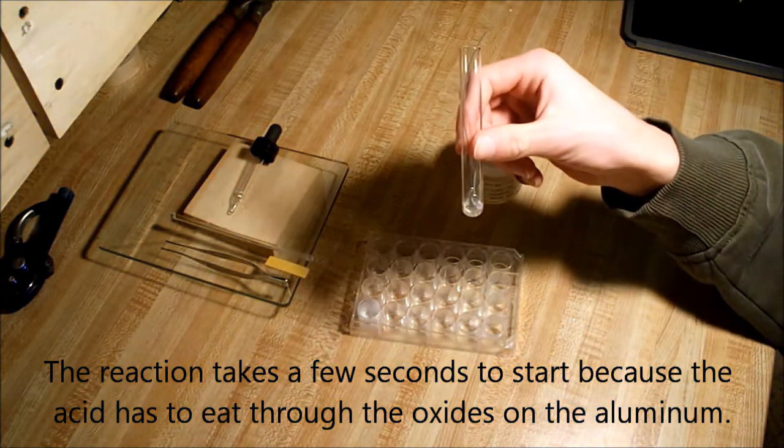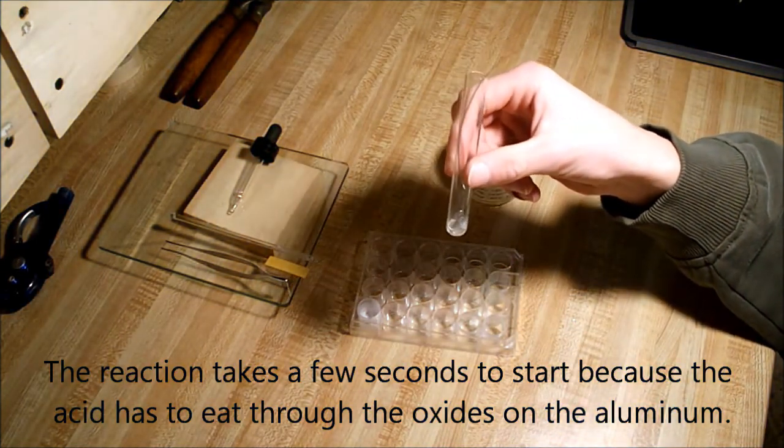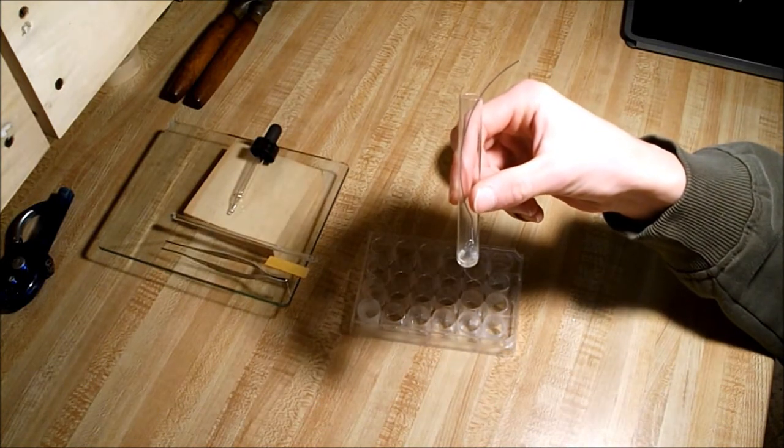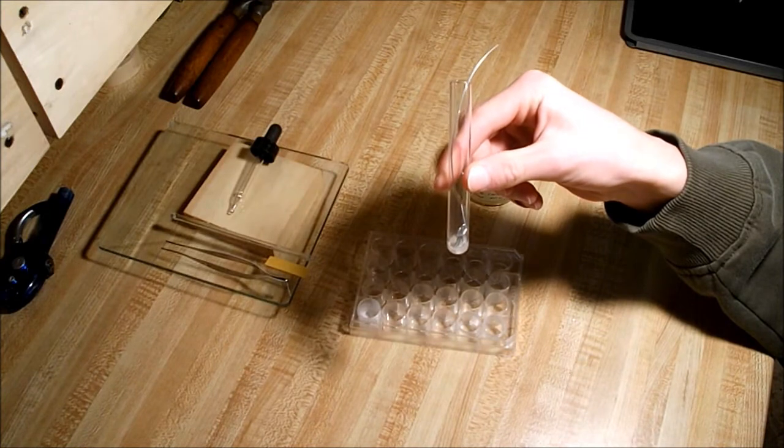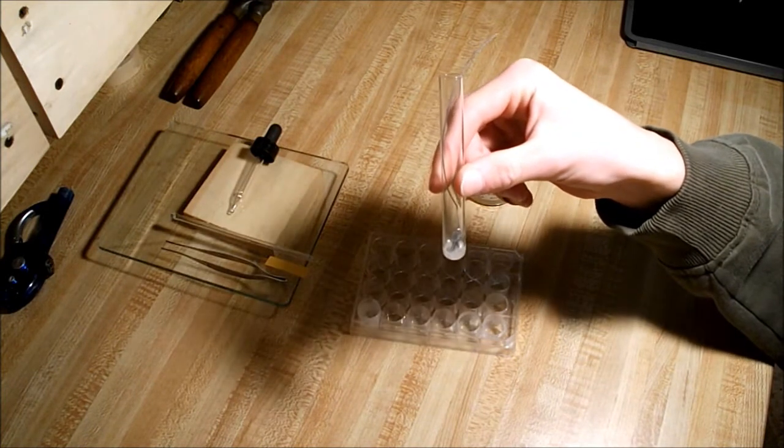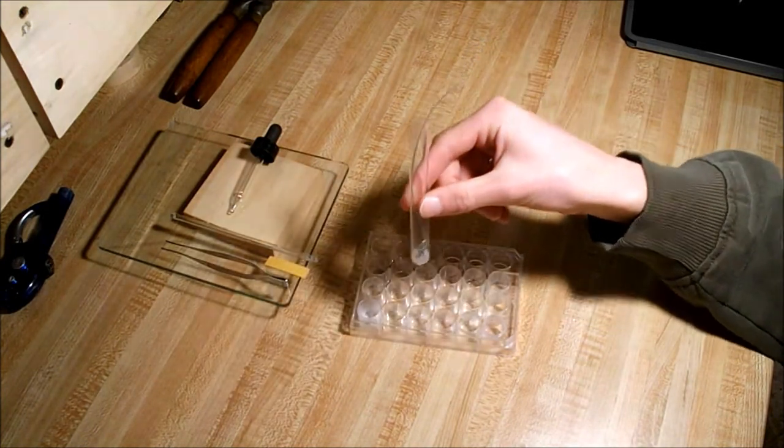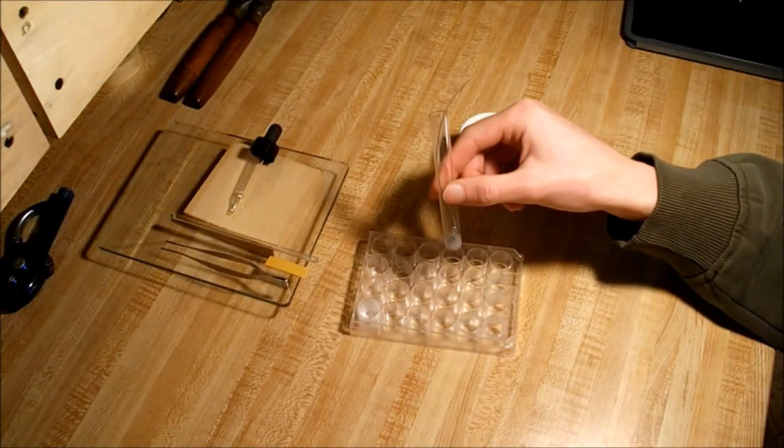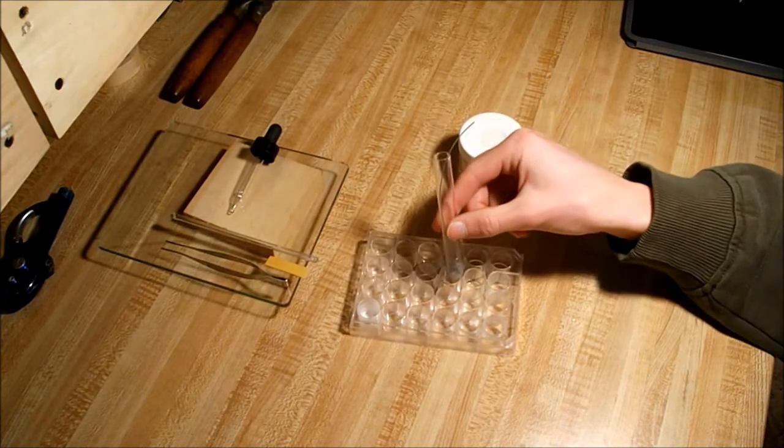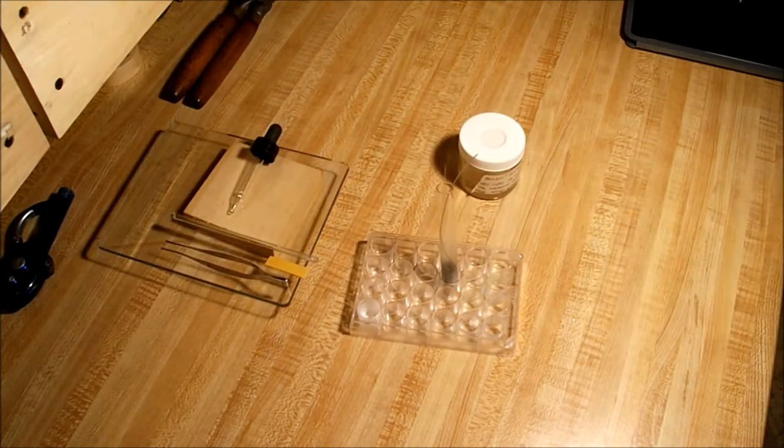The reaction is already starting to accelerate. You can see it's now turning gray. I'll set that down.